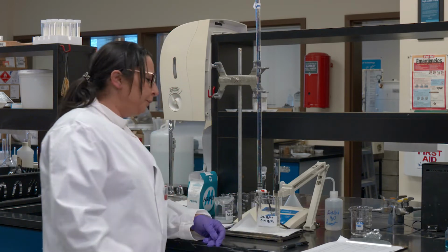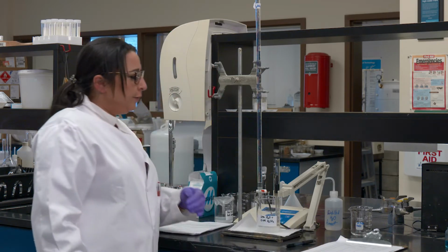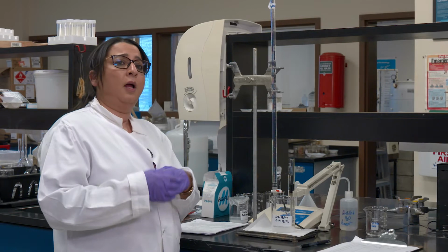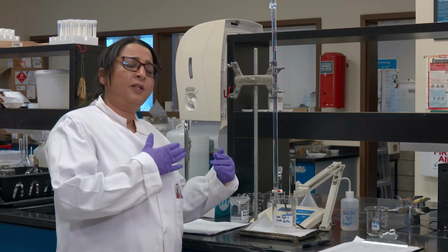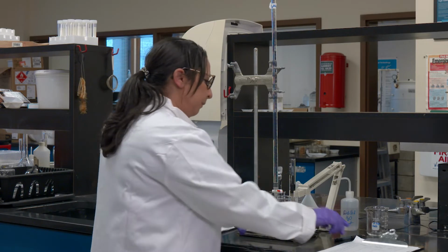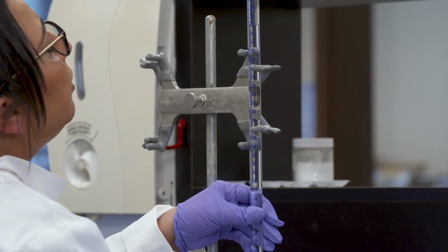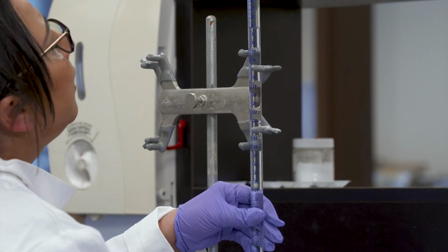I like going really slow. Oh, sorry, we got the third reading. I go slow just because we don't want to miss those equivalence points. Remember I told you in my introduction that you want the equivalence point when carbonate is changing to bicarbonate, and the second one when bicarbonate is changing into CO2. We don't want to miss those important equivalence points. So go slow with the volumes and make a change accordingly if you have to. This is going to be my third reading now, and I think I'm going to stick to 1 ml.